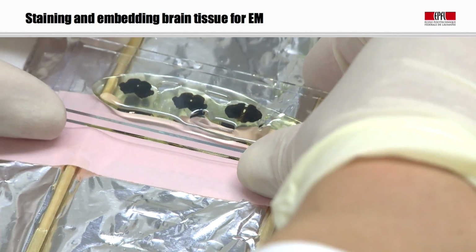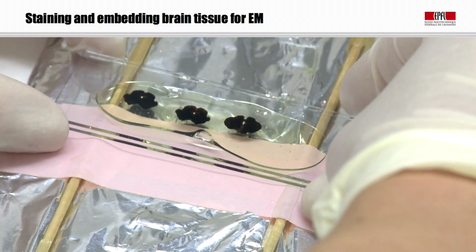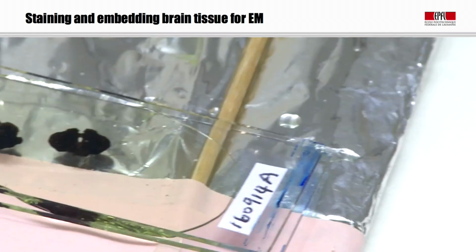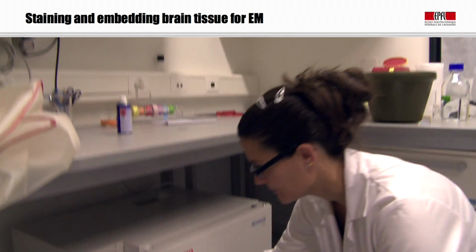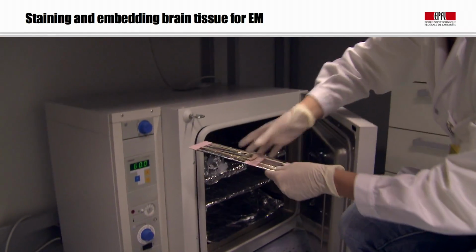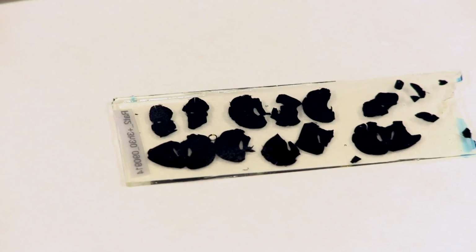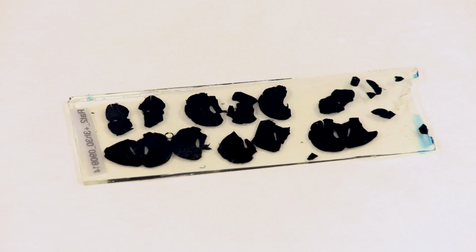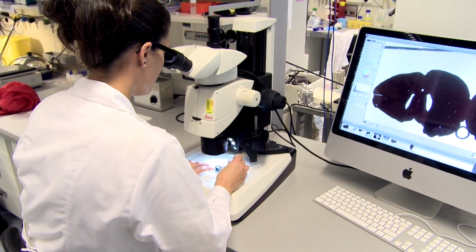And this sandwich containing the sections in between in the resin is then placed into an oven. And the resin is polymerized at 60 degrees C. This polymerization process takes about 24 hours to fully harden. What we end up with is a section of plastic, essentially, in which we've embedded our brain sections.